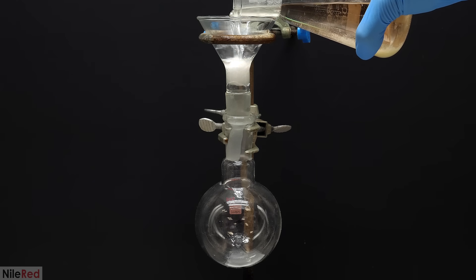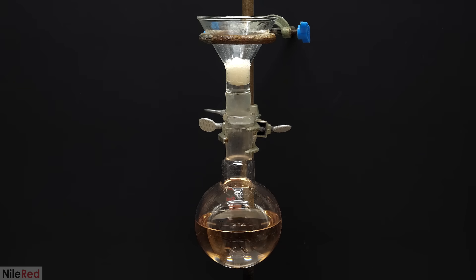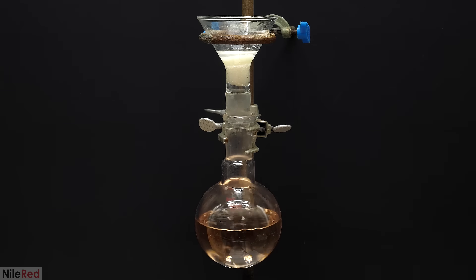To separate the magnesium sulfate, it's really easy, and I just filtered everything through a cotton ball. When everything had passed through, I washed the magnesium sulfate in the flask, and the bit that was in the cotton, with a small amount of ether.